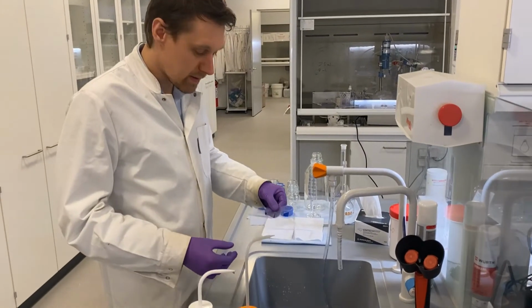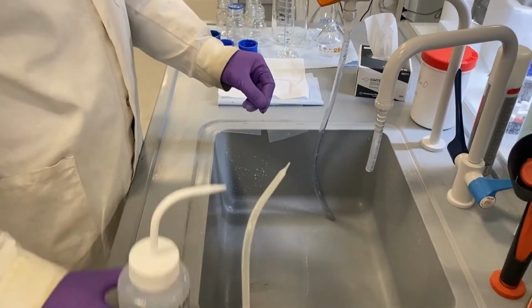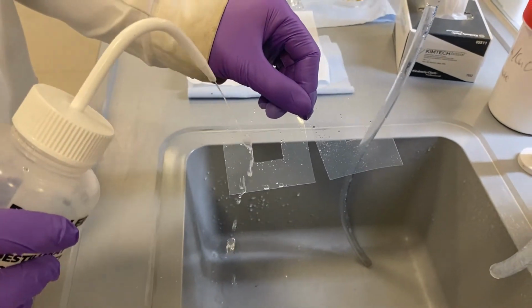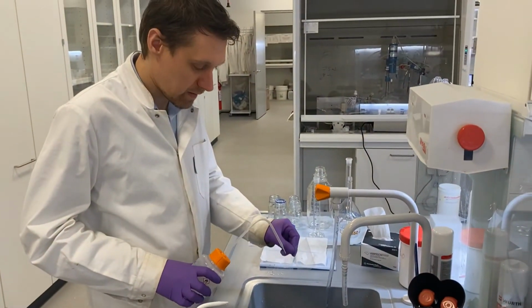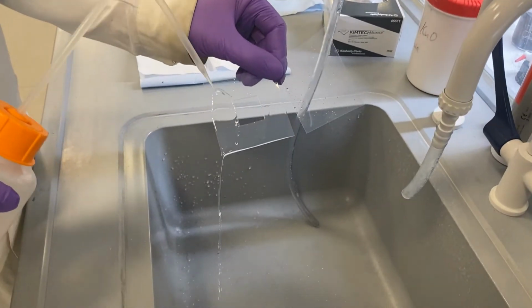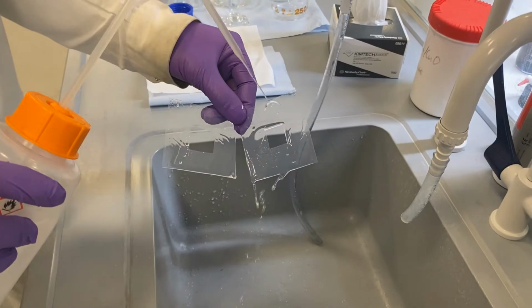So next thing we do is to clean them. They are still pretty dirty. We need to clean them before we can use them. And I'll just show you, if we're just using water, it just peels off due to the high surface tension between Teflon and water. So instead, we're using alcohol, ethanol in this case. And you can see how this goes down much easier.